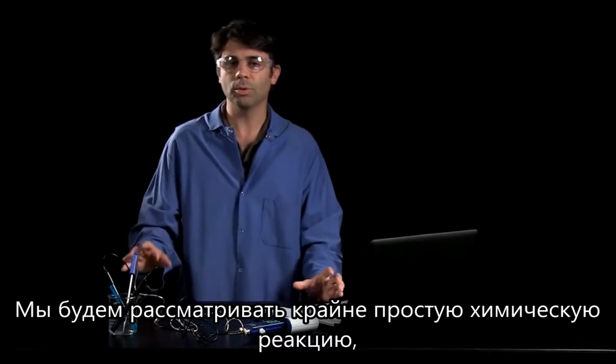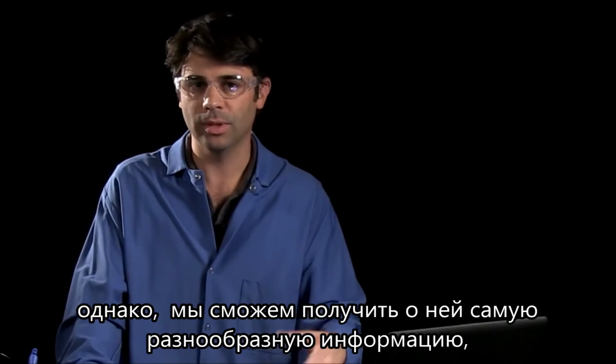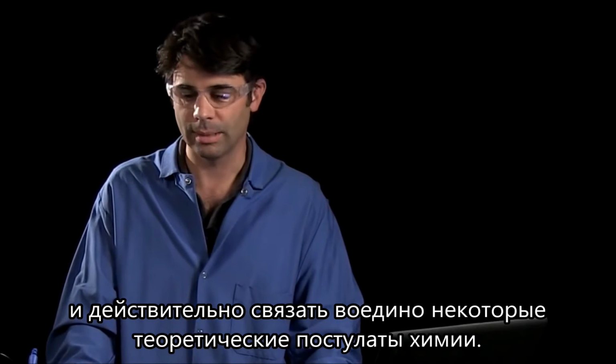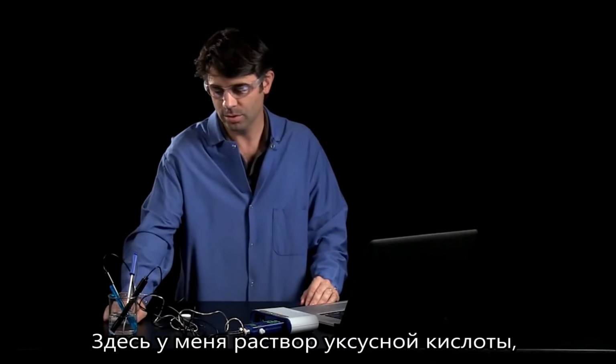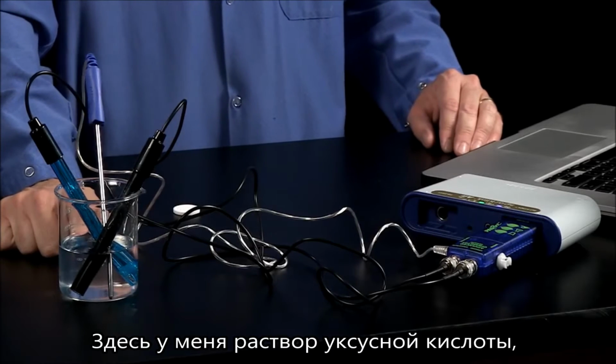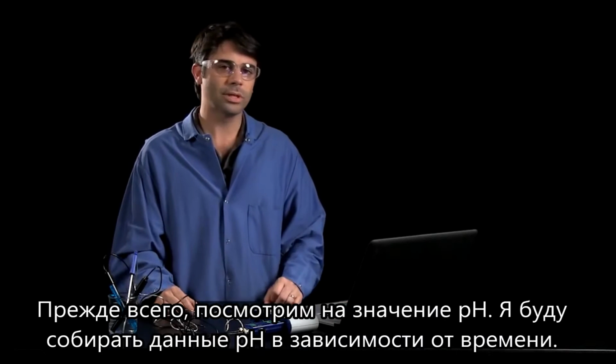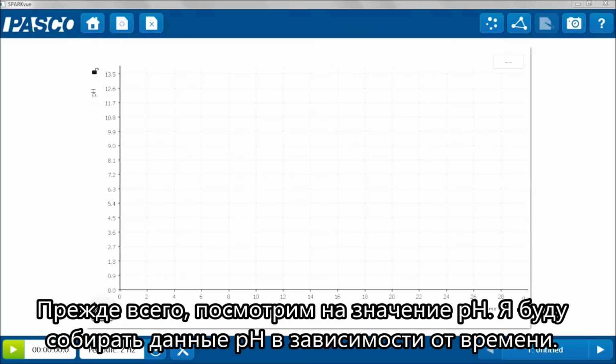So we're going to look at a very simple reaction, but see that we can get complex information out of it and really tie in some broad concepts in chemistry. In the solution here, I have just some acetic acid, and I'm going to add an Alka-Seltzer to it. So first we'll look at the pH. Over here, I'm going to start my data collection of pH versus time.